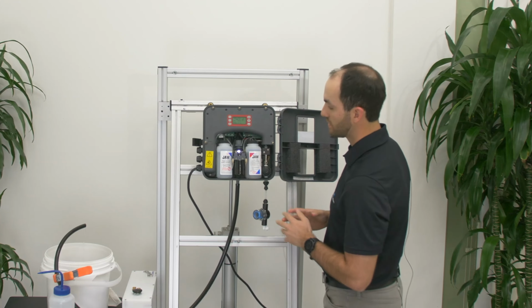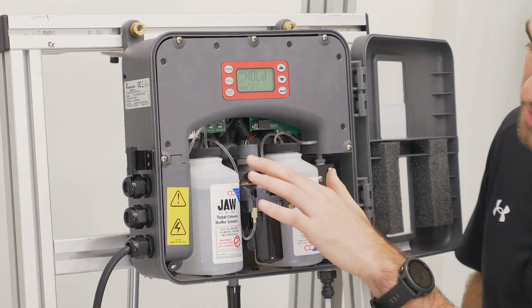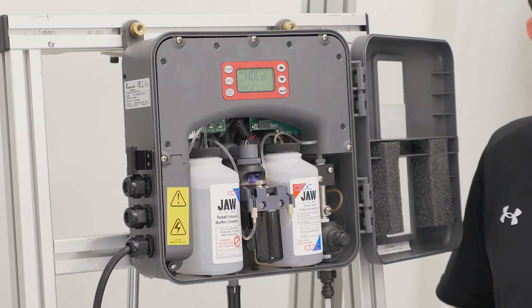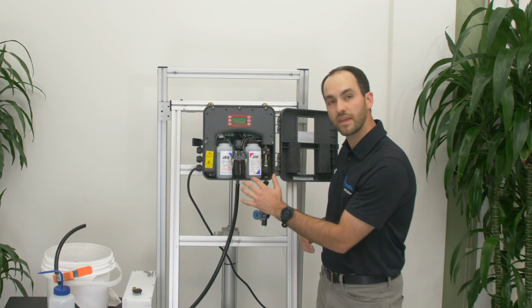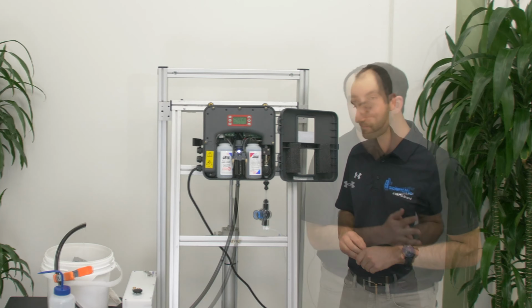At this point in time, the cuvette should be empty if you do not have an NPRG error. As you can see, there is still water inside this cuvette. This shows us that since we have a tube hooked up here, we're getting some back pressure that's not allowing the analyzer to drain. We are going to try taking off this line to see if the analyzer will drain, and then we can test to see if our intake solenoid is blocking.